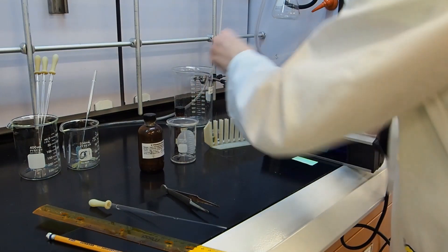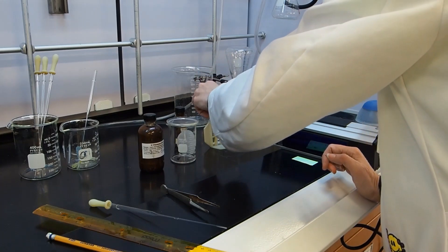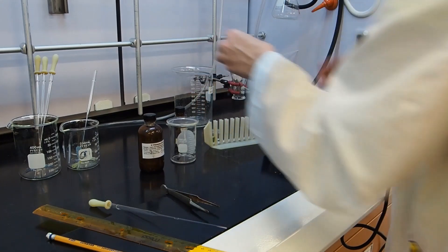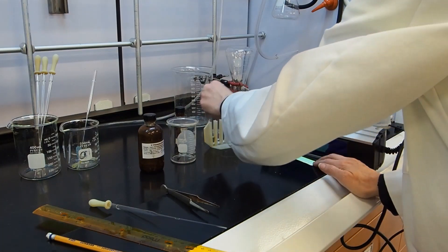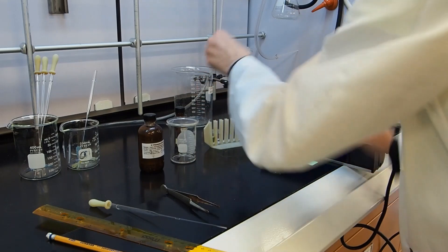If you want to be thorough, you can add what's called a cross spot. I'm going to spot both solutions on top of each other, so a little bit of the cresol and a little bit of the reaction mixture.